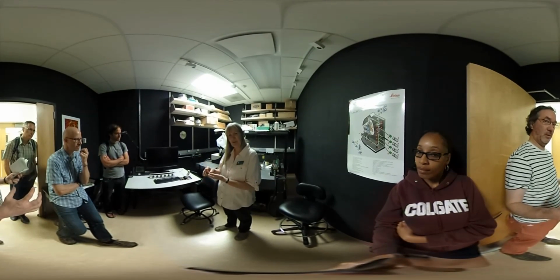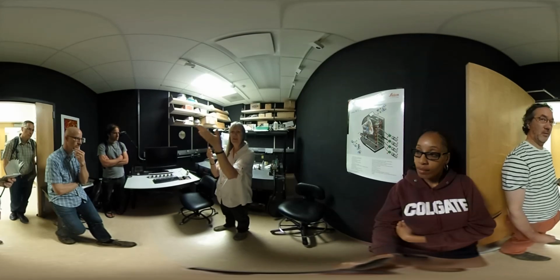So you can look at each individual section by itself, but it doesn't have too much depth to it. But you can take all of those sections and stack them together. And then you can rotate that at 360 degrees, and that's how you make a 3D image. And then you can pseudo-color with cyan, blue, and red, on a gray background, and make it depth.